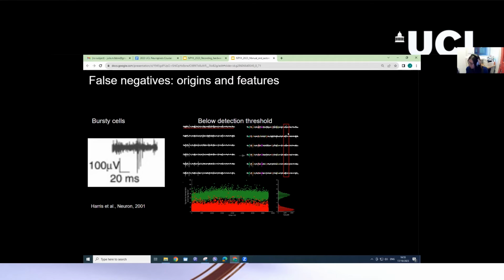False negatives also occur a lot when you have low amplitude spikes. So here you see a snippet of raw data, and spike sorting algorithms typically have some sort of threshold in order to detect spikes. And you can see that denoted by this red bar here. And any spike above that is going to be detected, but smaller spikes are not going to be detected. So here you can see I've colored some spikes that, in this case, Kilosort 2 detects in this data from different neurons. And you can see one spike here that definitely exists, but is not detected because it's a smaller spike that's on the same order as noise. And there are characteristic features of this without needing to go through all your raw data manually.